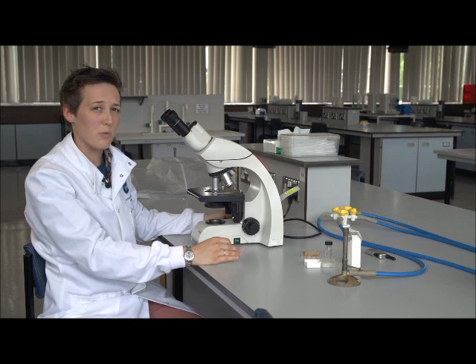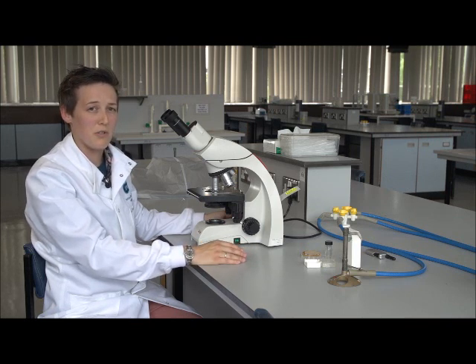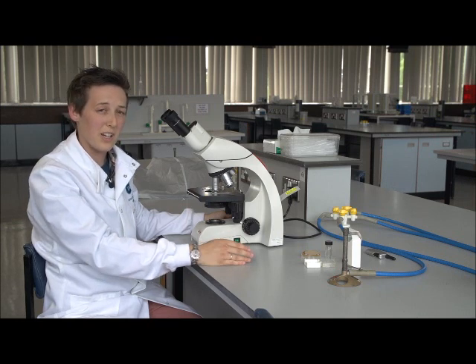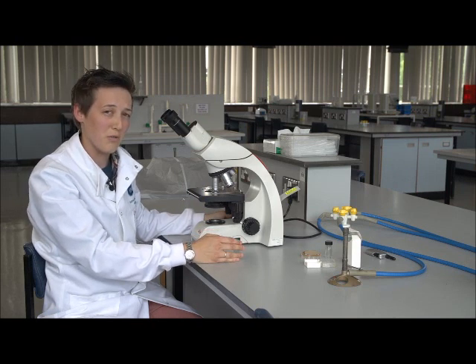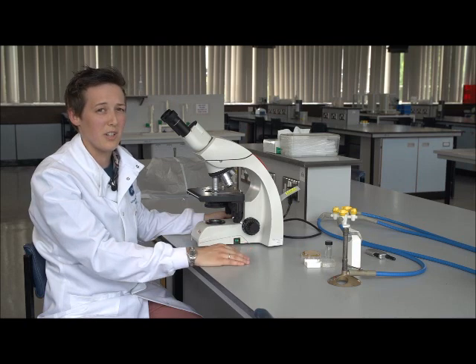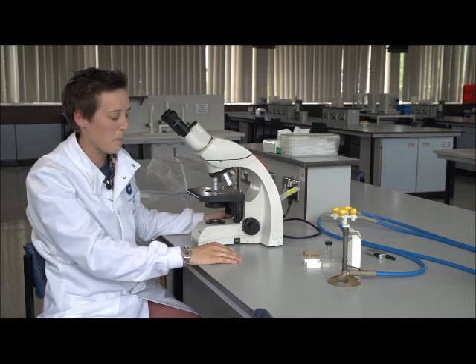Now, phase contrast works by exaggerating differences in the light as it passes through different specimens. So as the light passes through a cell, it has a different refractive index as to when it passes through the water around that cell. And this is exaggerated and transformed into a contrast that we can see down the eyepieces.